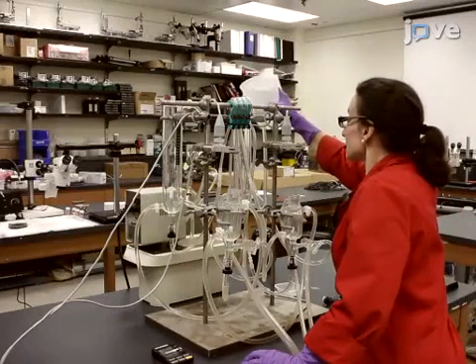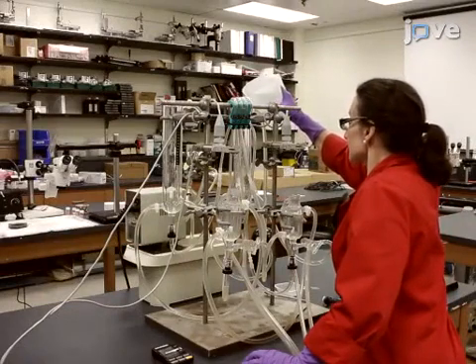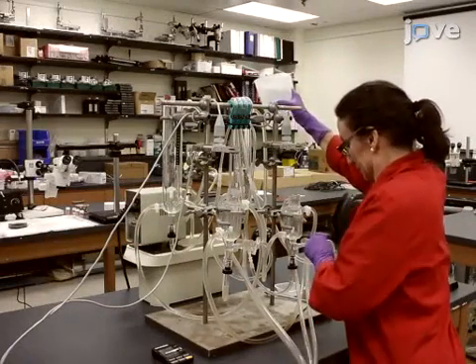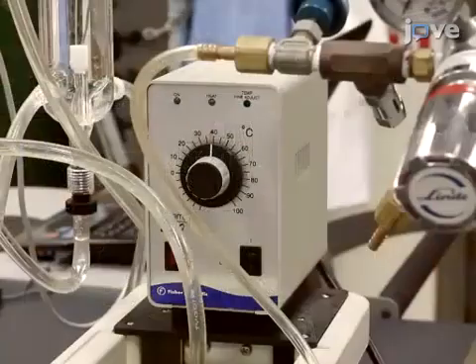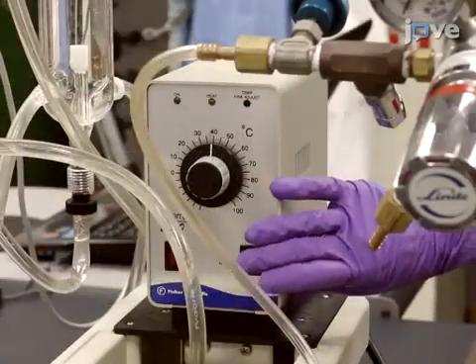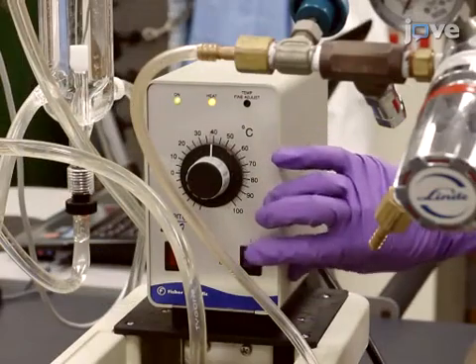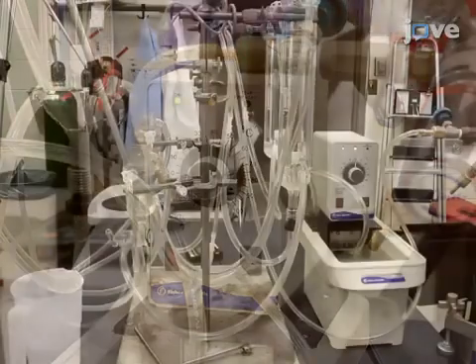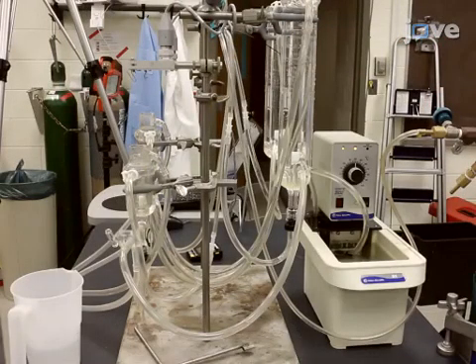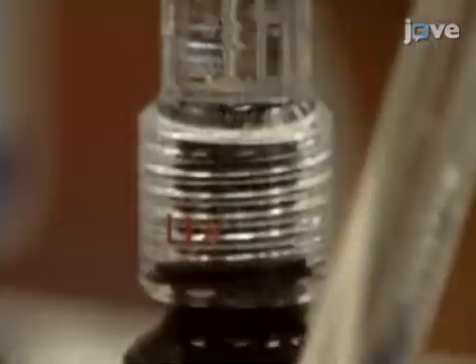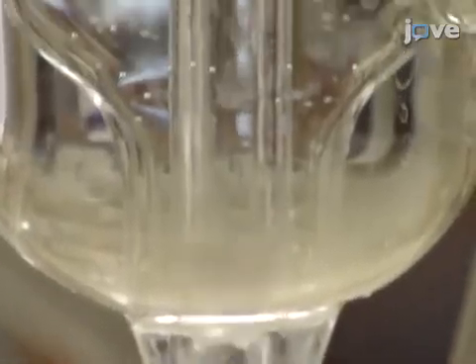There are a few preparations that must be stressed. It's vital to preheat the tissue bath system to 37 degrees Celsius by turning on the recirculating heated water bath. The water must flow into each component at the lowest barbed connection and flow out at the highest barbed connection. Each component must be connected.